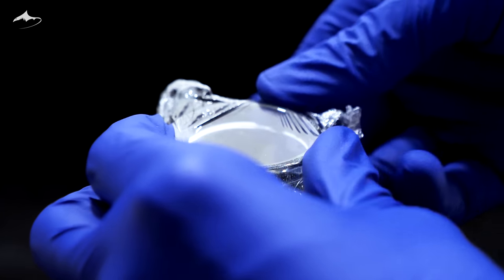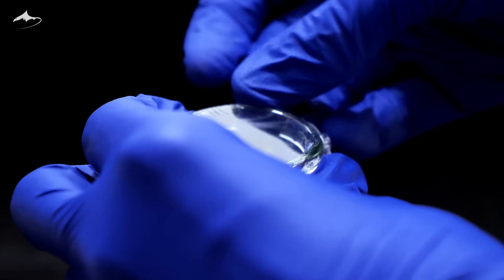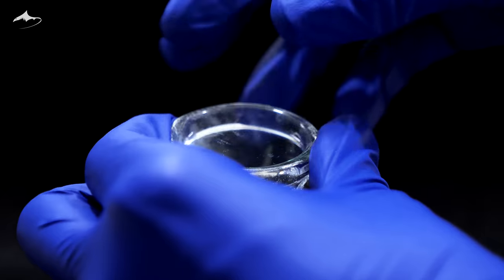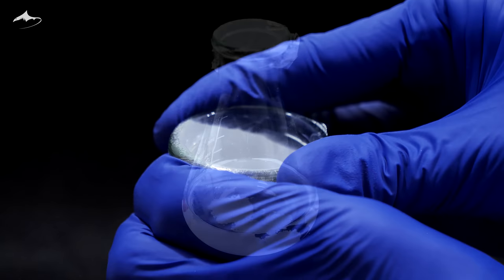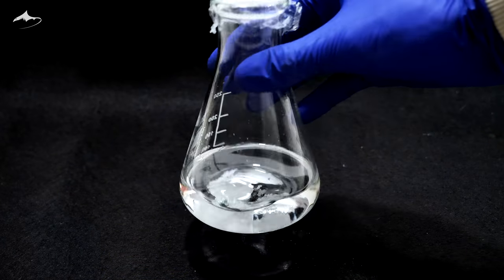It is then covered with plastic wrap and allowed to rest until the next day, as the process of hydration of the drying agent is slow. Time to filter it up.